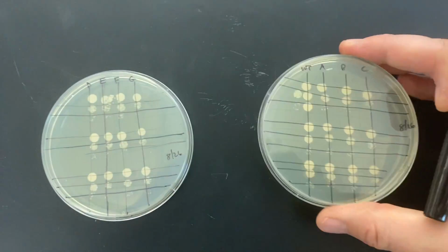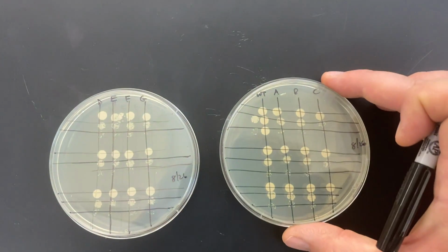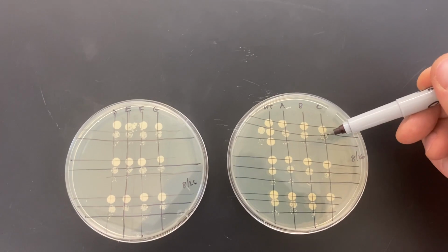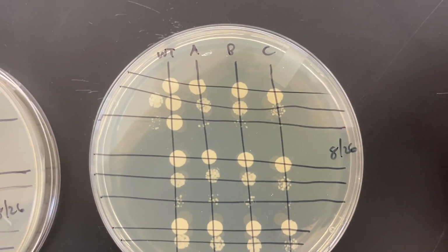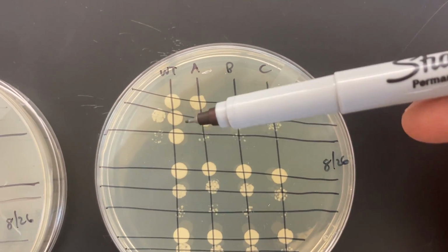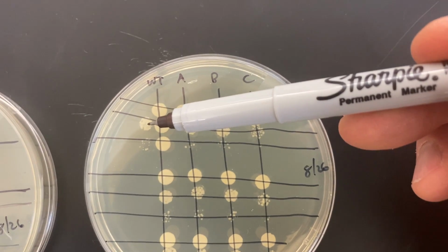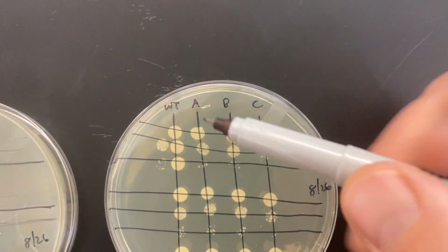Moving on to our DNA damage assay. If you remember, we had a dilution, so diluting from the full strength solution, 1/10 and 1/100th strength. Zoom in a little bit. This was the error that we made and acknowledged last week. So wild type full strength, and then these were all full strength. What I meant to do was 1 to 10 and 1 to 100, and those got put over in this area. So kind of ignore these.